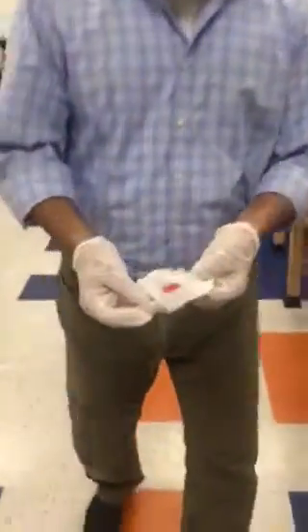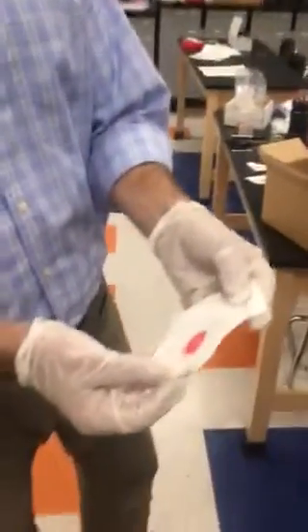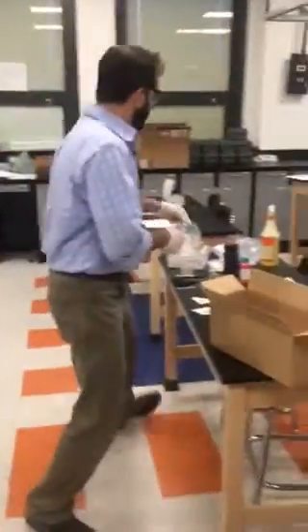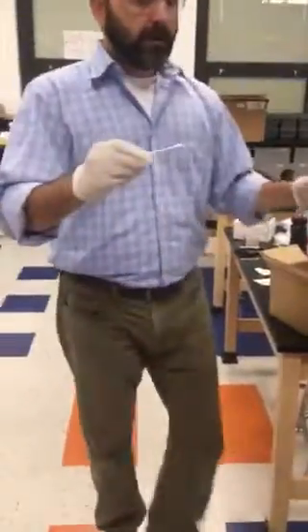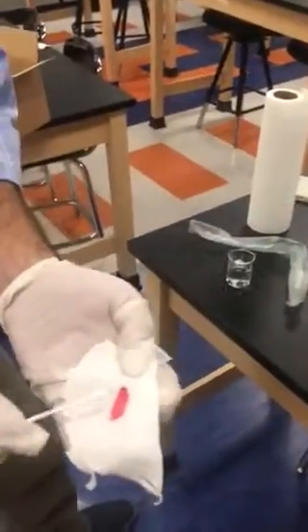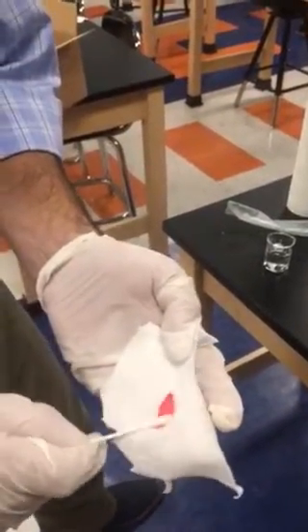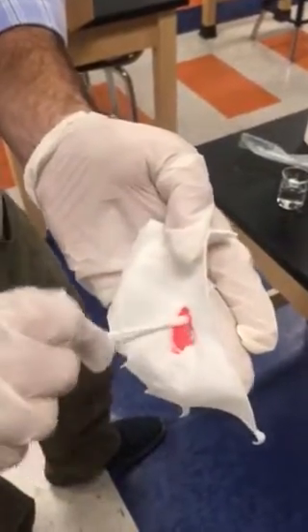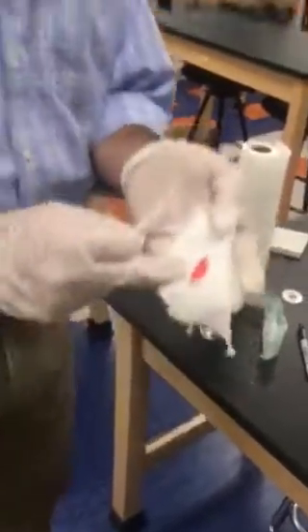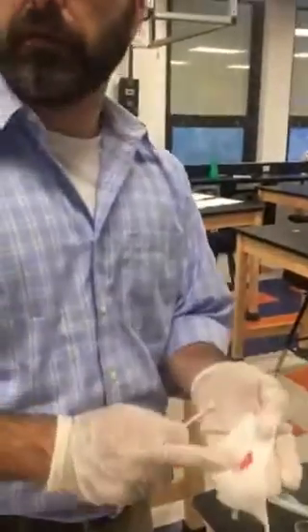So then, one more test. If we have a sample of dried blood or a dried red substance on a cloth and we need to determine whether or not this is blood, our method is going to be very simple. We're going to take a forensic swab and dip it in distilled water. We want to make sure it's distilled water so there are no impurities that contaminate our sample. We're then going to take our dried blood stain and try to get as much of it on the Q-tip as we can. This is not destroying the sample, by the way, which is important, and we want to save this blood for further tests.